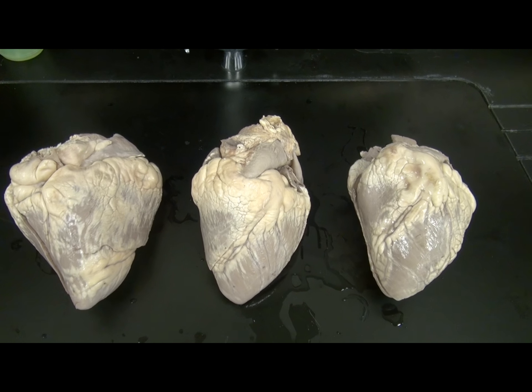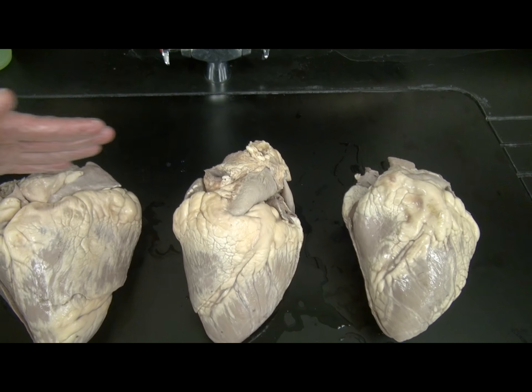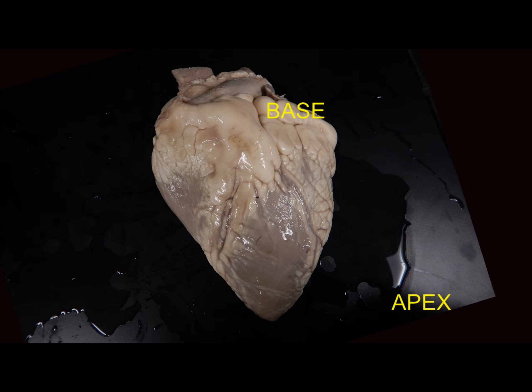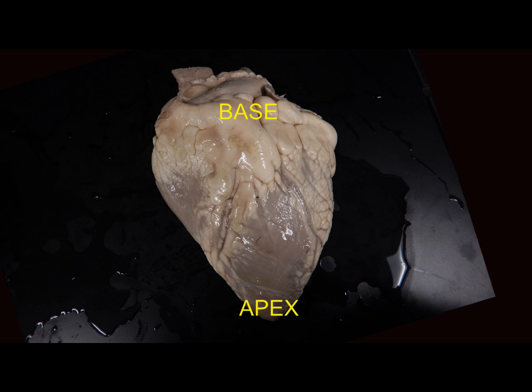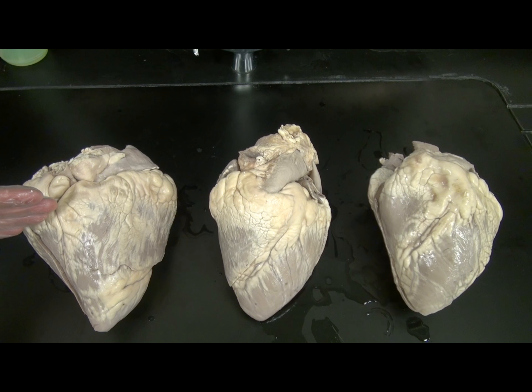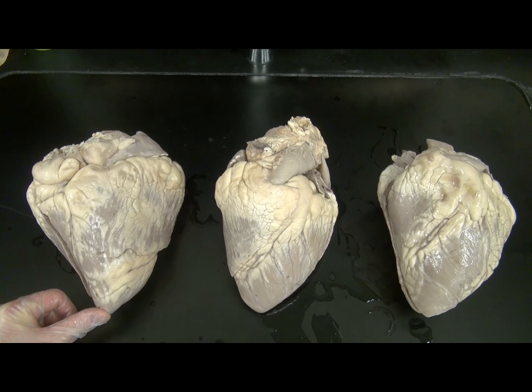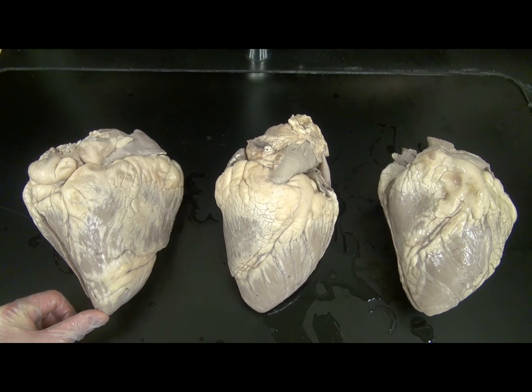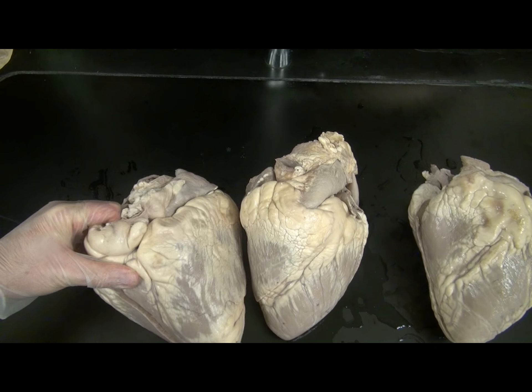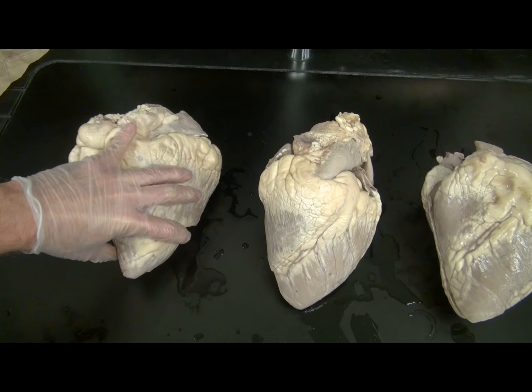As is evident in these cow hearts, the heart is roughly triangular, with a base and an apex. In humans, the base is around the second intercostal space, and the apex in the fifth intercostal space, several inches to the left of the midline. Note that the great vessels of the heart originate near the base of the heart.